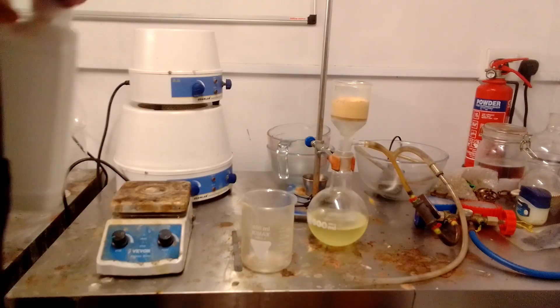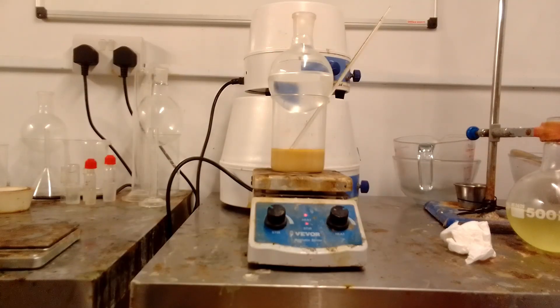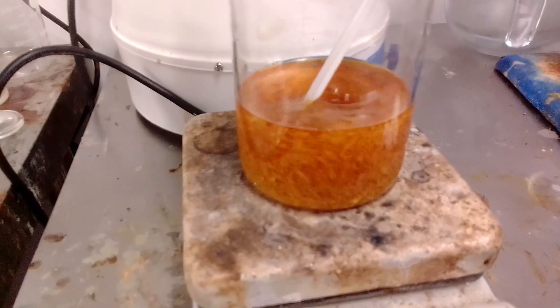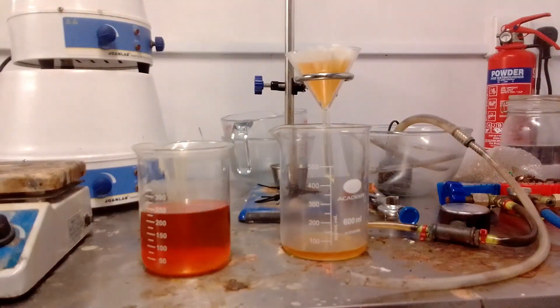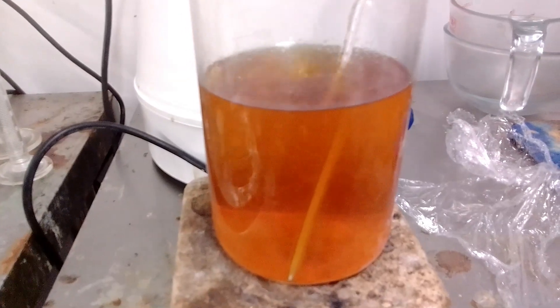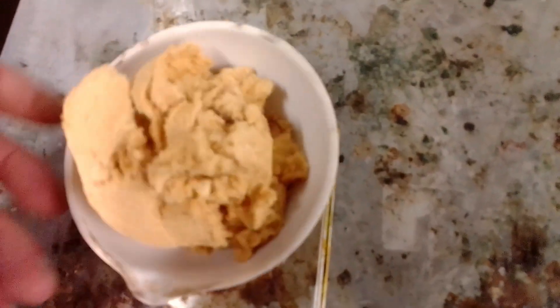An attempt was made to recrystallise it from methanol, 40g; isopropyl alcohol, 120g; acetone, 30g; and water, 30g. The recryst started with the intention of simply dissolving the product in methanol and then adding enough water to precipitate it out, but there was some unknown material that just refused to dissolve in the alcohols and acetone, which I removed by decanting most of the solution, filtering out the last bit, cooling overnight, and recovering the handful of solids on the pump. Another 250g of water was added to the filtrate and the mixture was boiled down until it became turbid. Crystals soon formed as it cooled. After cooling in the fridge overnight, the product was recovered and dried on the pump as 46.6g of very fine orange needles, giving an overall yield of 94% with respect to methyl anthranilate.